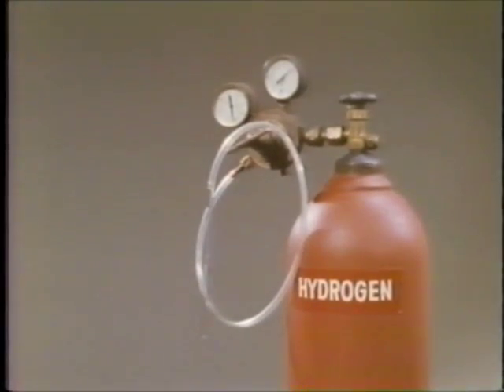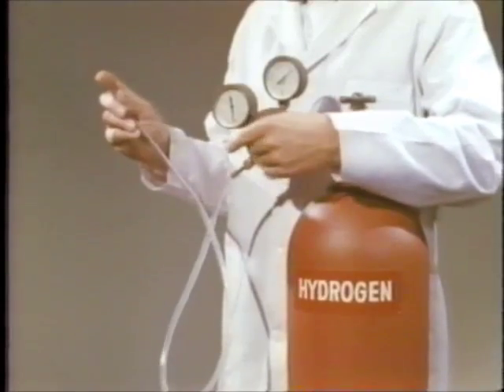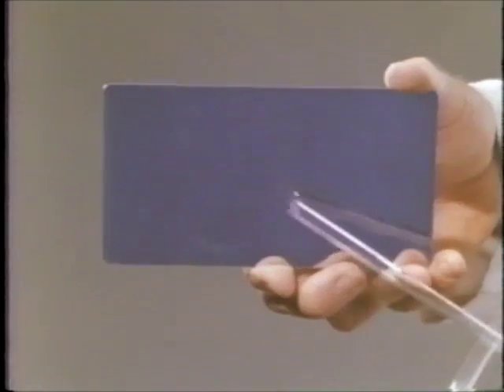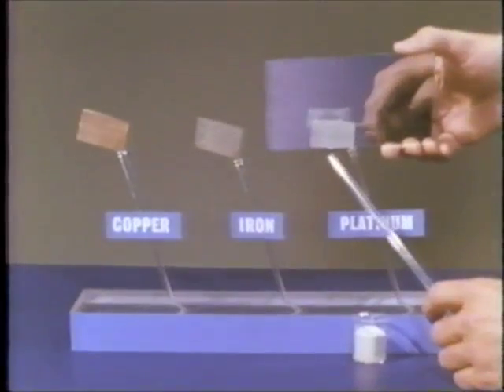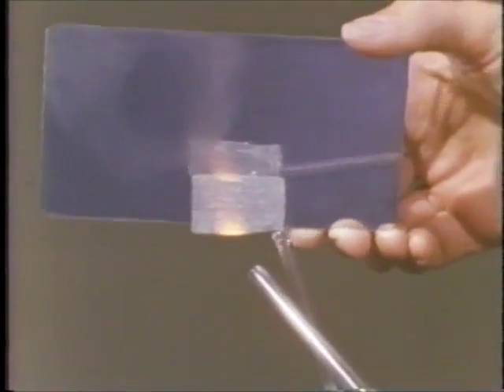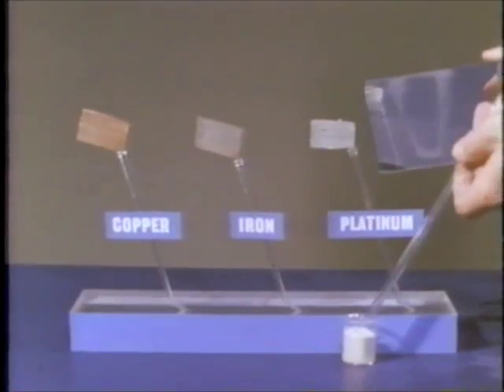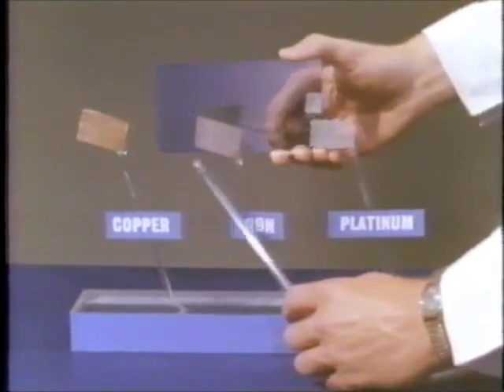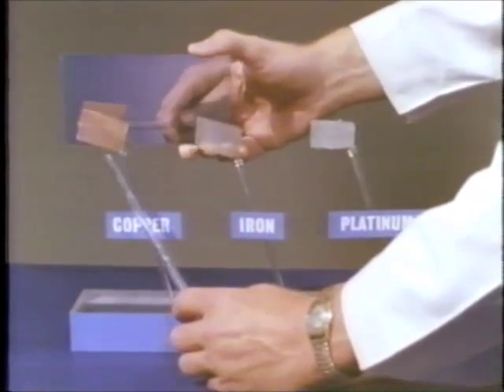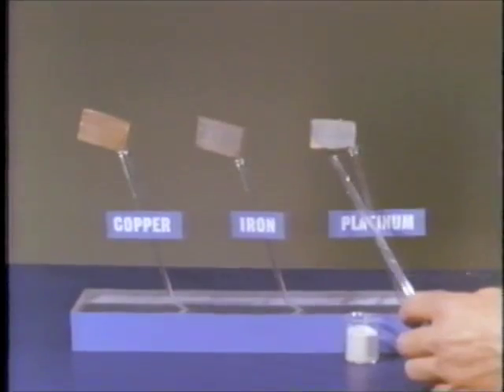Now let's study another reaction. Hydrogen gas from this cylinder, combining with oxygen from the air, to produce water. When hydrogen flows into air at ordinary temperature, the reaction is slow — not enough water is formed to condense on this mirror. When hydrogen gas passes over the platinum gauze, the reaction between hydrogen and oxygen speeds up. Water condenses. The platinum is a catalyst. The heat of reaction ignites the hydrogen. The iron gauze has no visible catalytic effect on this reaction. Neither does the copper gauze. The catalytic platinum surface provides more favorable geometry and bonding properties than iron or copper.